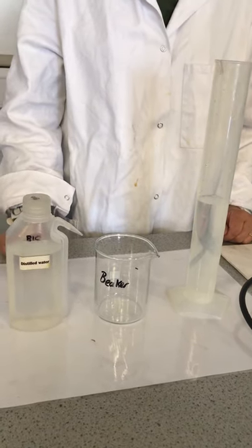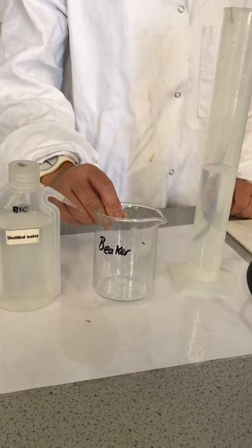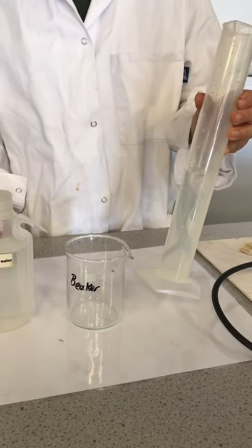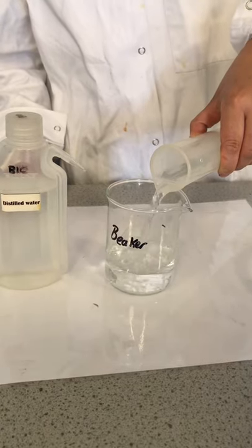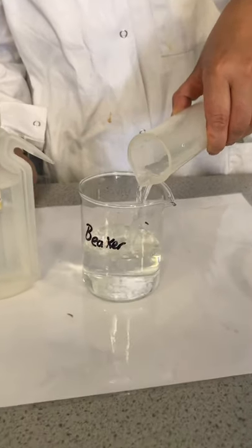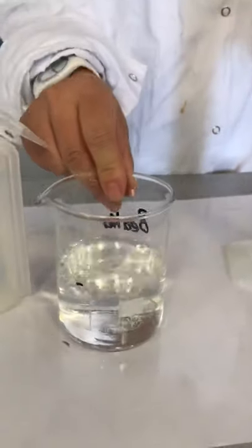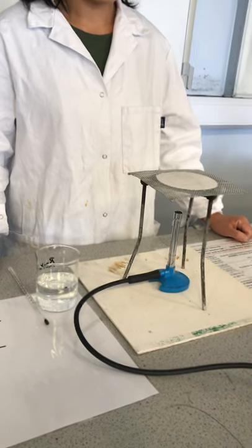Step two: take a 250 ml glass beaker and fill this with 150 ml of water using a measuring cylinder. Do not fill the beaker to the top because when water boils it may splatter outside the beaker.